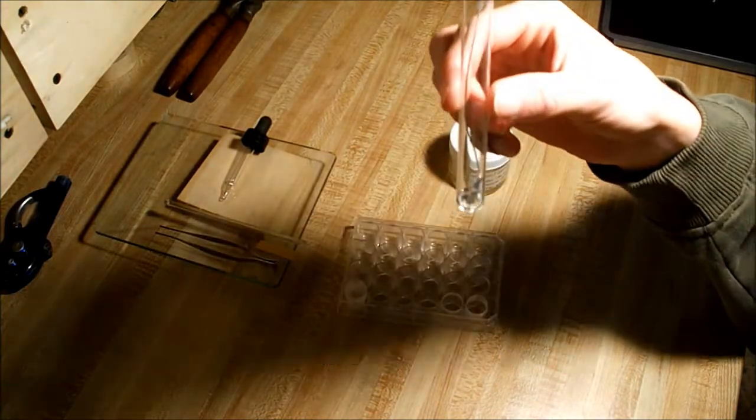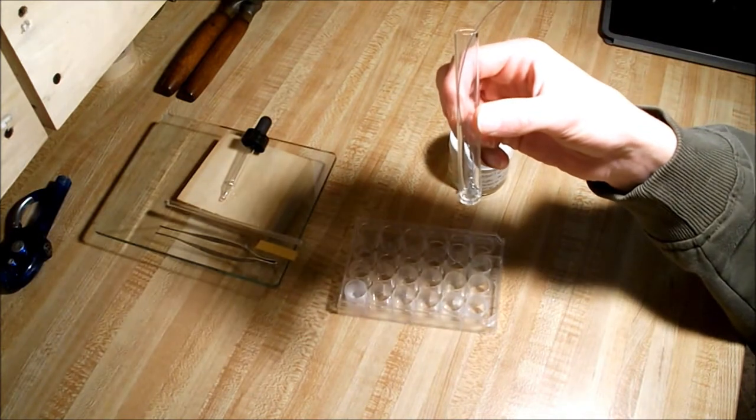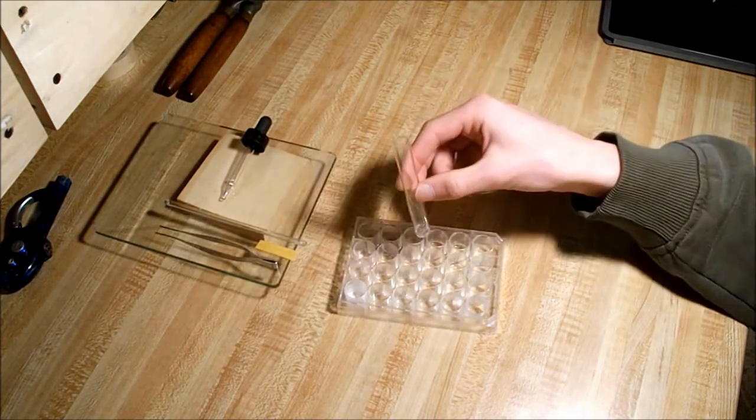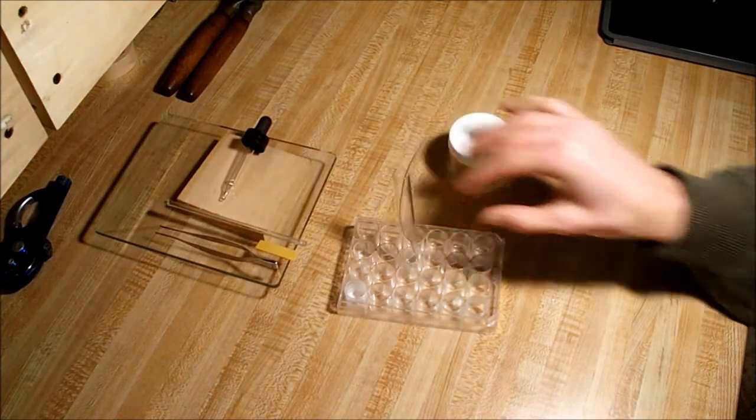Now this one gets a little bit volatile. You'll see it's not fizzing very much right now, but if you just leave it for a few minutes it should really take off. I'll set that down.